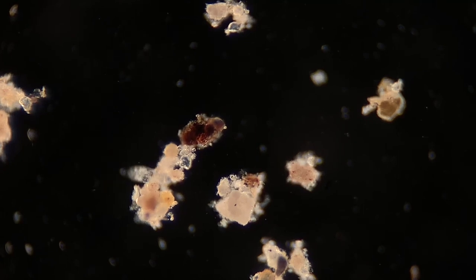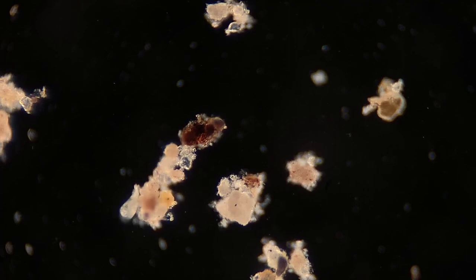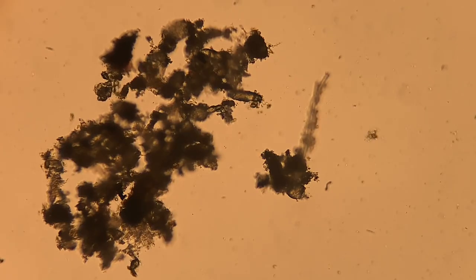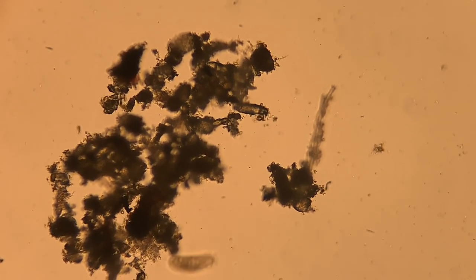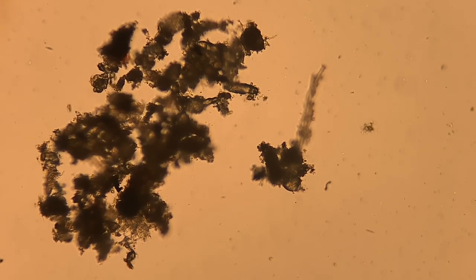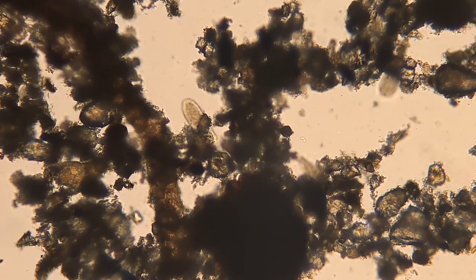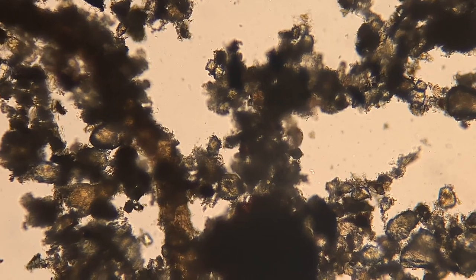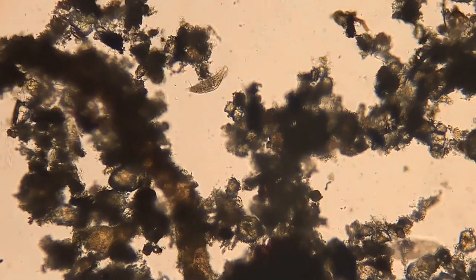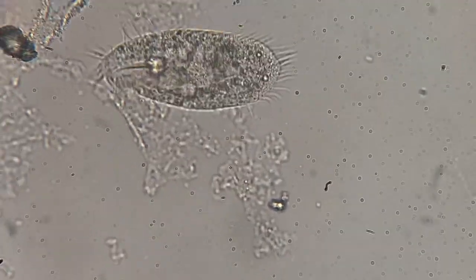Next up, we have what looks kind of like a paramecium. Paramecium you've probably heard about in biology classes — they're long, oval-shaped, and they have hairs all over them called cilia that they use to swim around. But these guys are a little bit different. I believe these are called spirotrichs, and what makes them different is that most, if not all, of their hairs are on the ventral side — the front or ground side of their body — and instead of using their hairs just for swimming, they use them for crawling around.